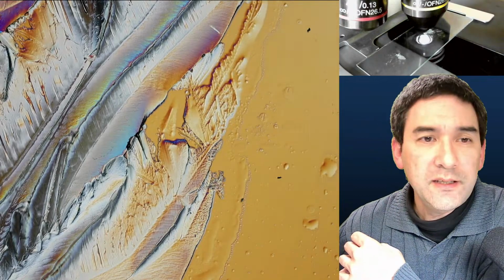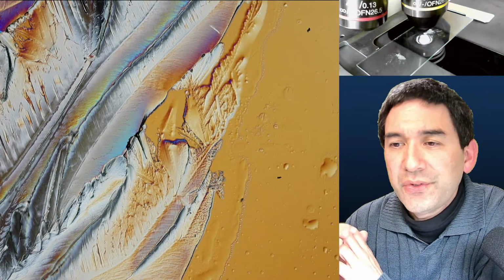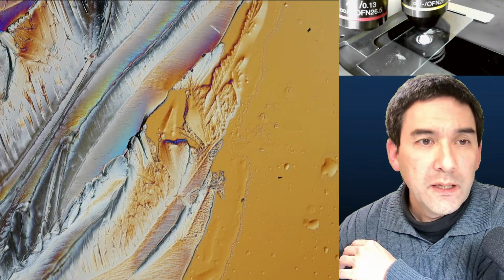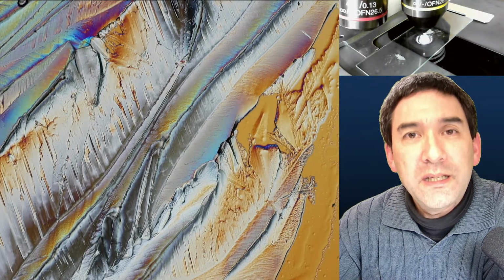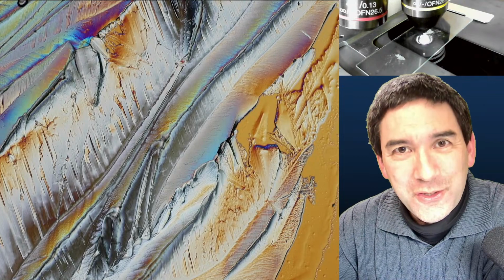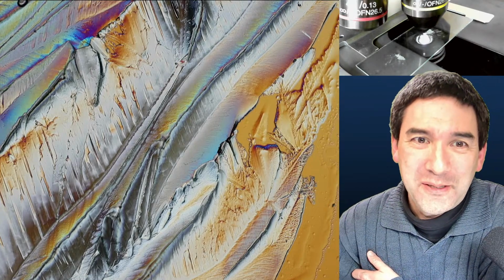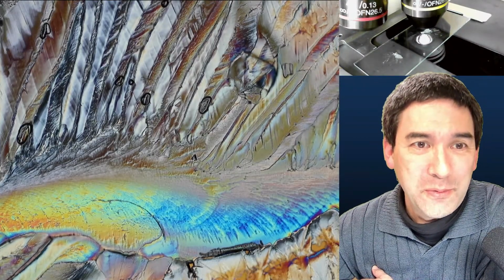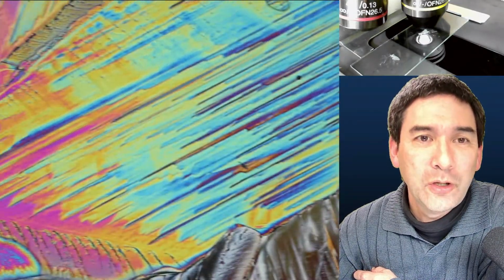So this here is citric acid. And I remember you said that for substances that have high surface tension, we should use alcohol. That is also something that I've tried. So for example, instead of mixing in soap, it is also possible to mix in some alcohol. As a matter of fact, this might even help dissolve some of the substances. However, be aware that the alcohol will evaporate first, and what we're left over with is again water, and this again has a higher surface tension, and this might result in the same problems. So it is something that I've tried. It does work, but again, it has to be optimized. So again, mixing alcohol, water with the substance, because the alcohol also breaks the surface tension.